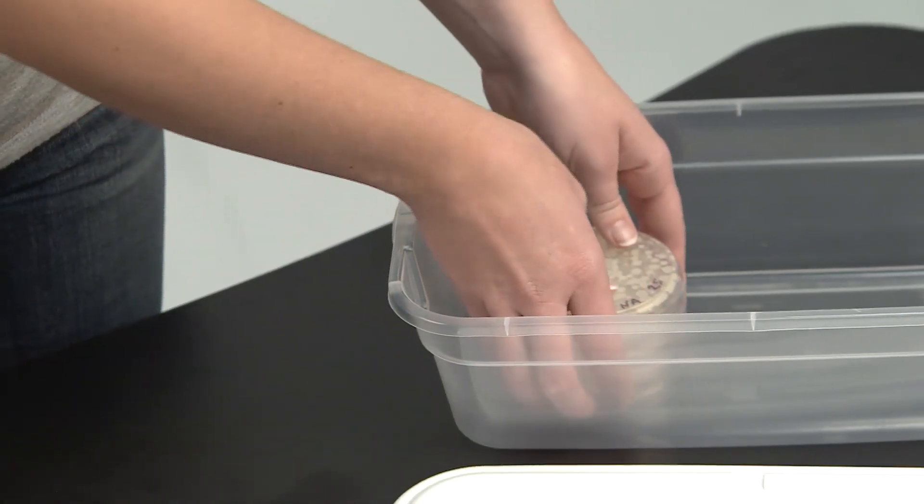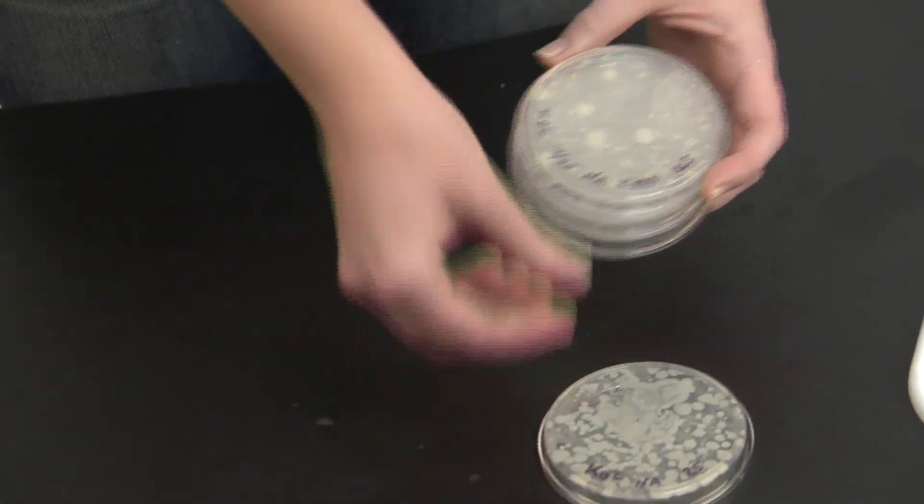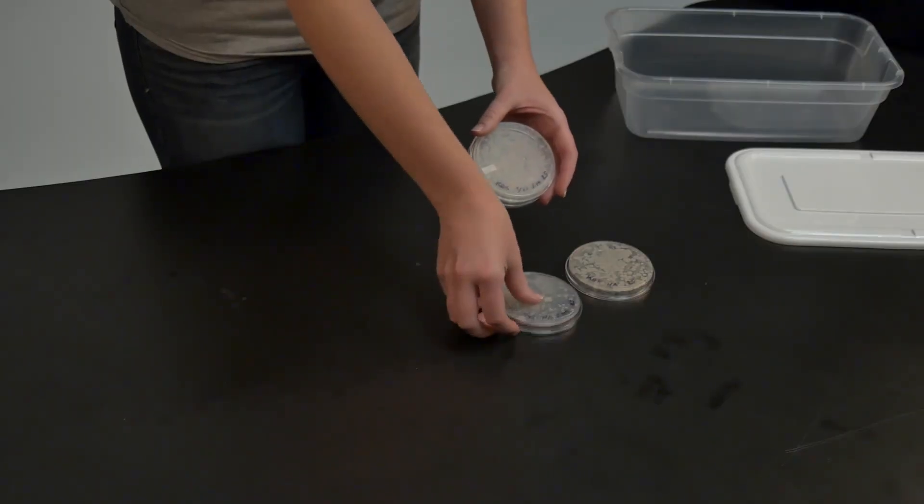After the plates have incubated for a period of time, we will use them to calculate the colony forming units, or CFU, from our soil sample.